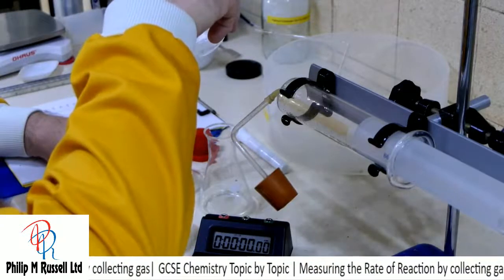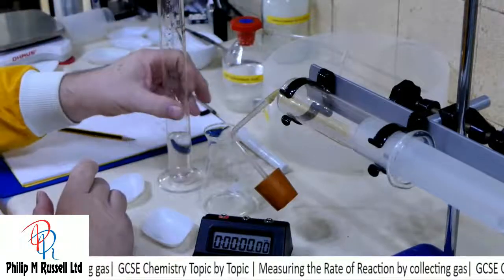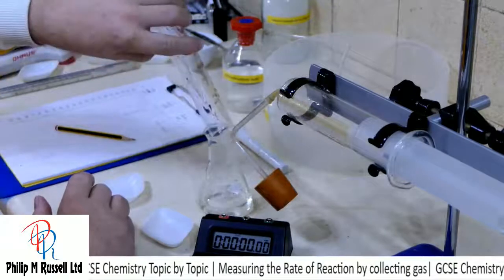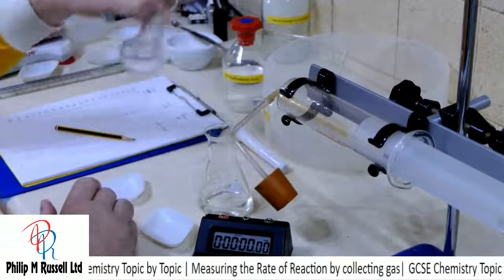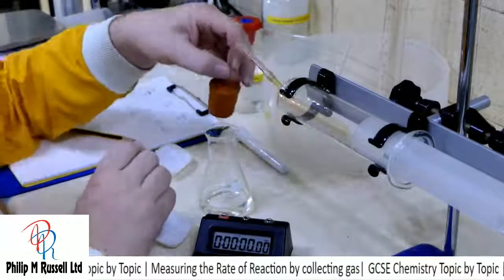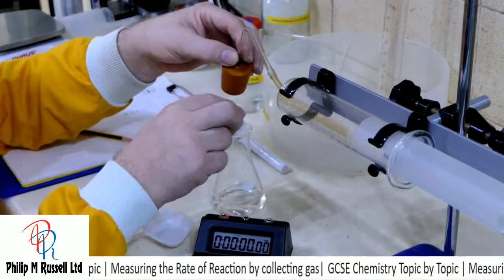We're just going for 30 because we know that is excess for what we want. And we've got now the large lump to go in, so we'll time this one as well. I'm making sure the bung's in the right place, so here we go. 3, 2, 1, go.